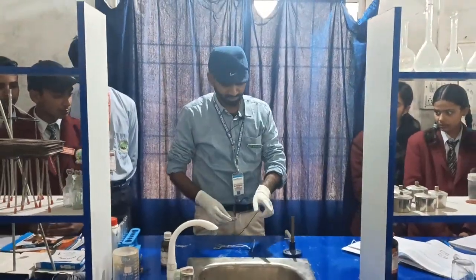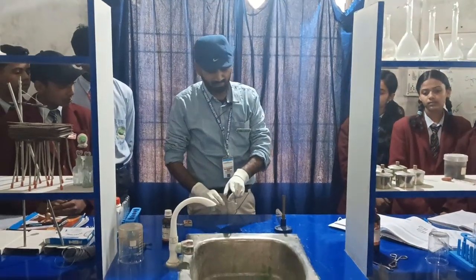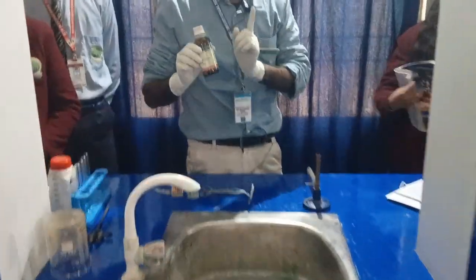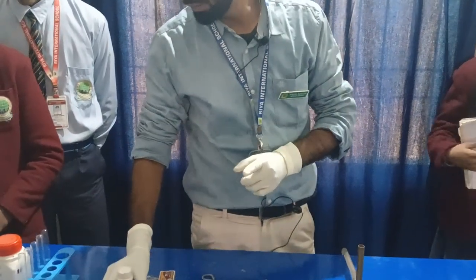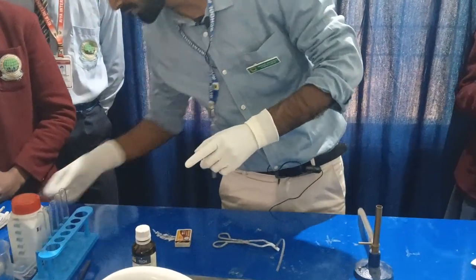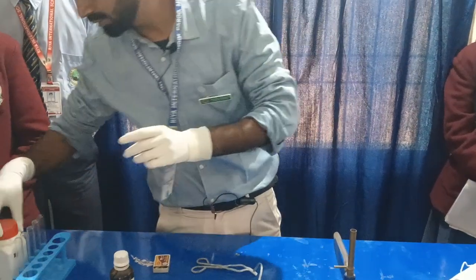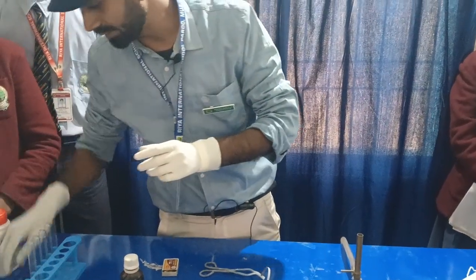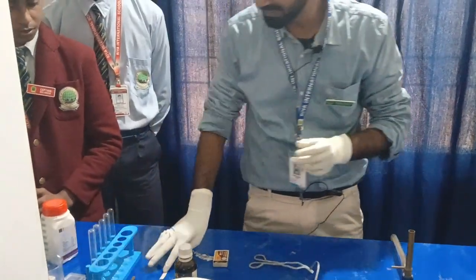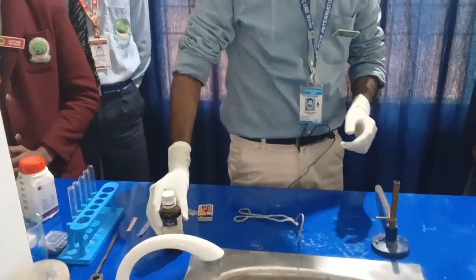For this experiment, we need a Bunsen burner, a pair of tongs, magnesium ribbon, and an indicator — either phenolphthalein or litmus paper. We will take both. The red litmus paper may look pink, but it is actually red litmus paper.